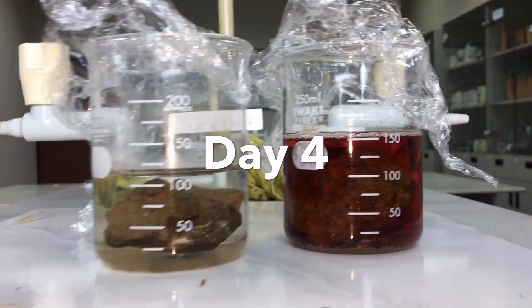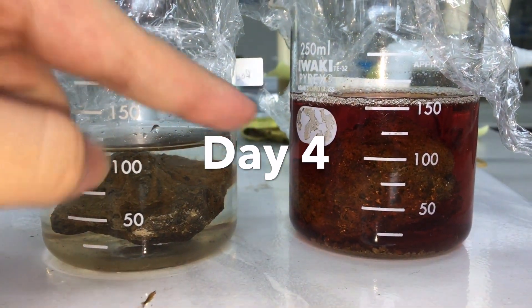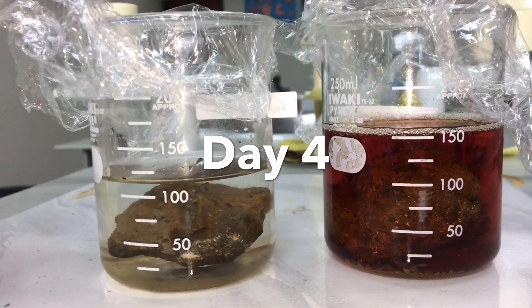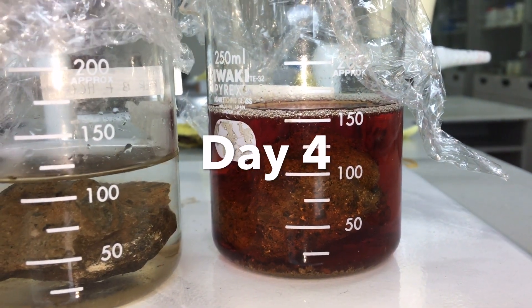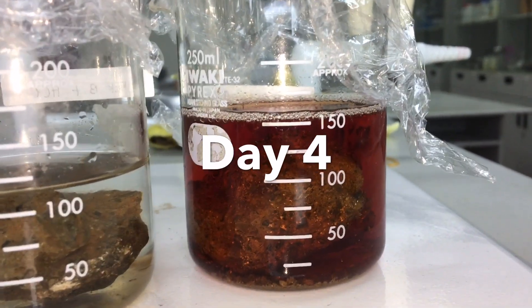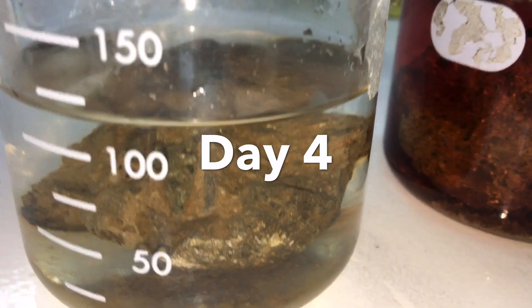Hey guys, it's day four. So these are the results. This one is the one with vinegar, rock A. And this is the one with hydrochloric acid, which is rock B. It's so cool. Especially rock A, because I think the one that has the most reaction is rock A with vinegar. Take a better look.